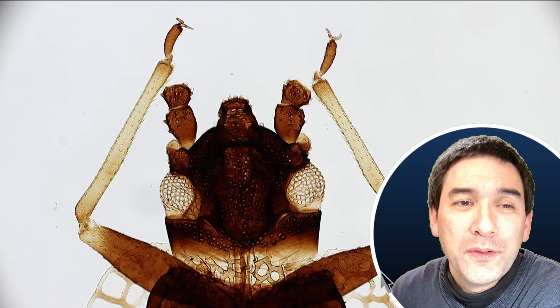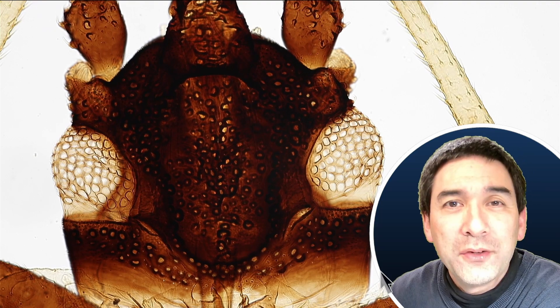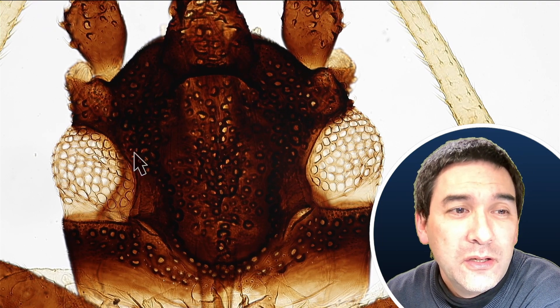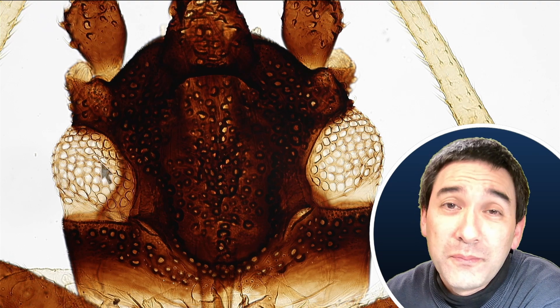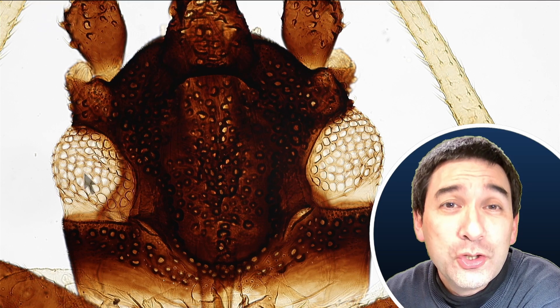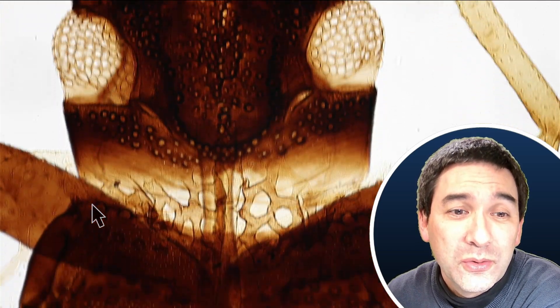Let's go up a little bit with the magnification. I'm now using my 20 times objective. Look at the beautiful compound eyes. Normally the compound eyes are actually very dark because they're pigmented. Here they look white, so apparently it's quite obvious that the person who prepared this insect has probably bleached it to remove all of the dark pigments. So it's a very, very nice specimen.